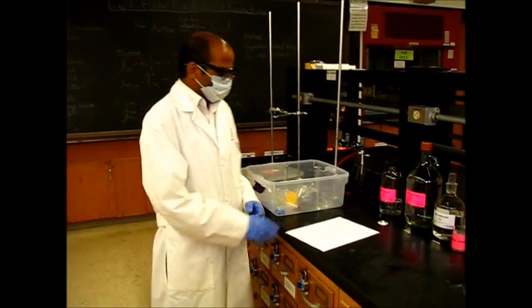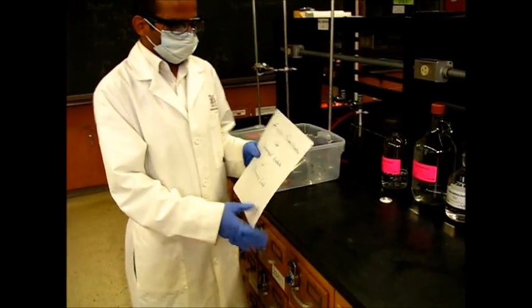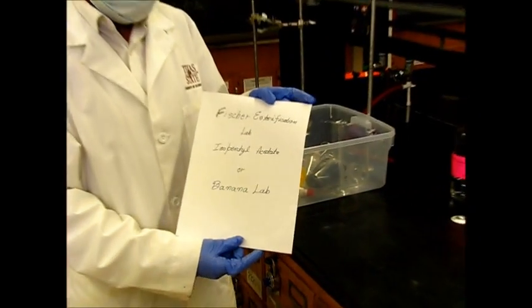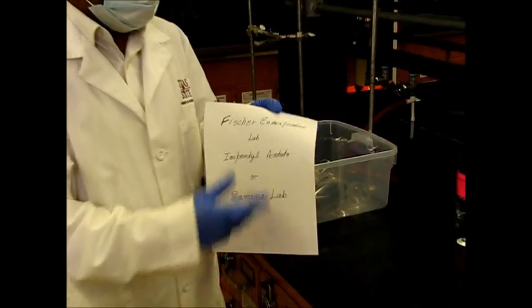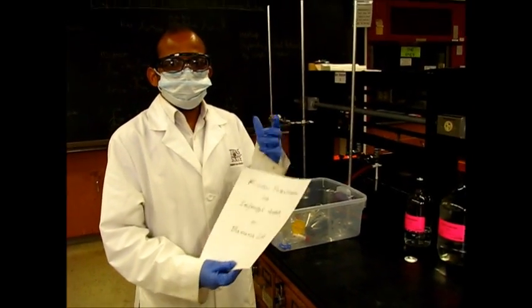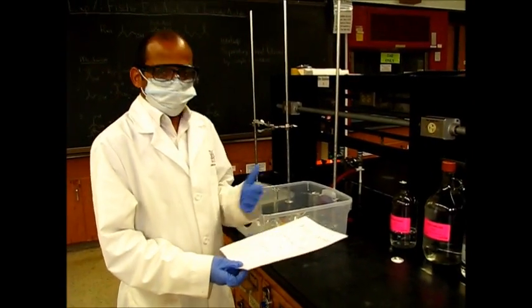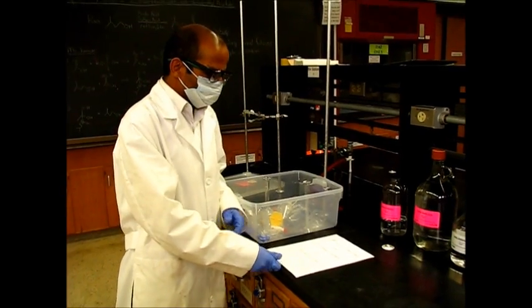Hello. Welcome to the Fischer Esterification Lab, which is called isopentyl acetate. Or this is also called banana lab, because this isopentyl acetate has a banana smell. So welcome to the banana lab.